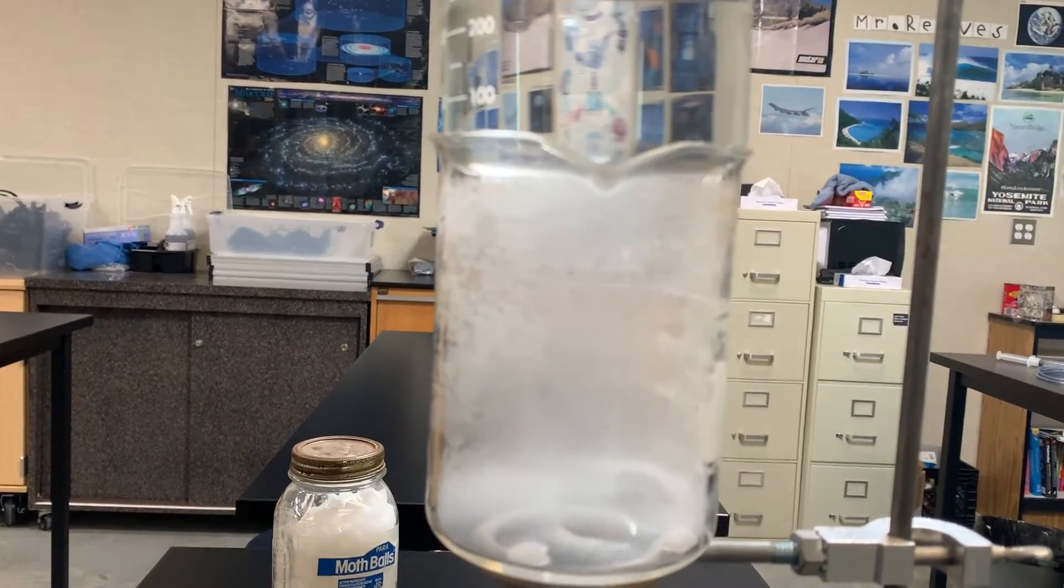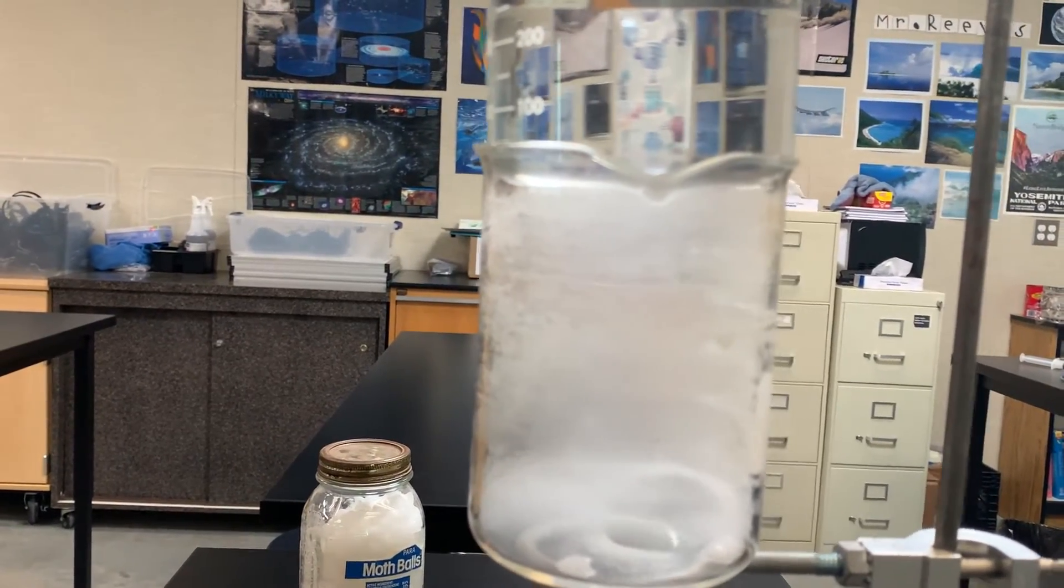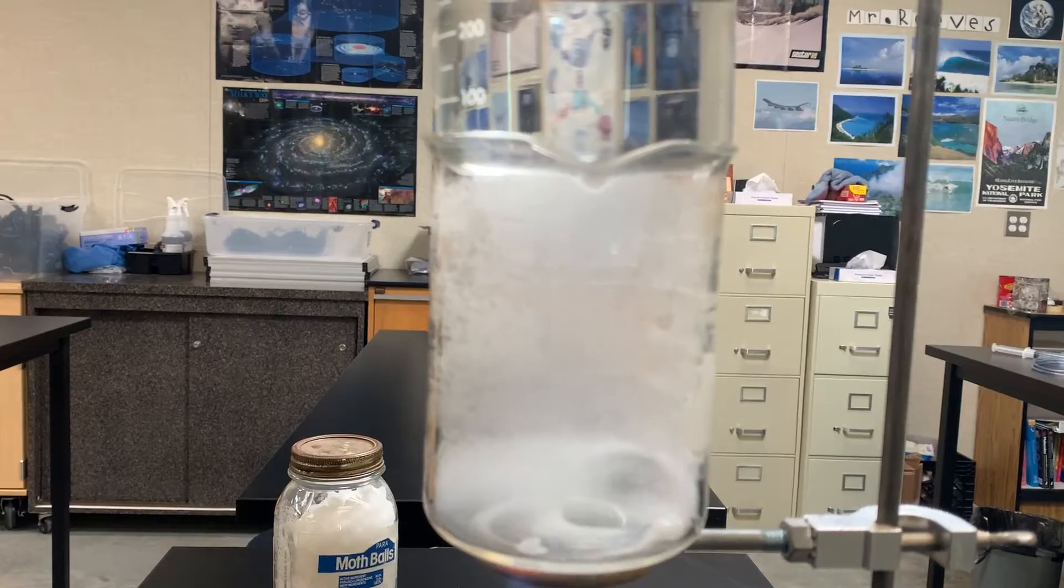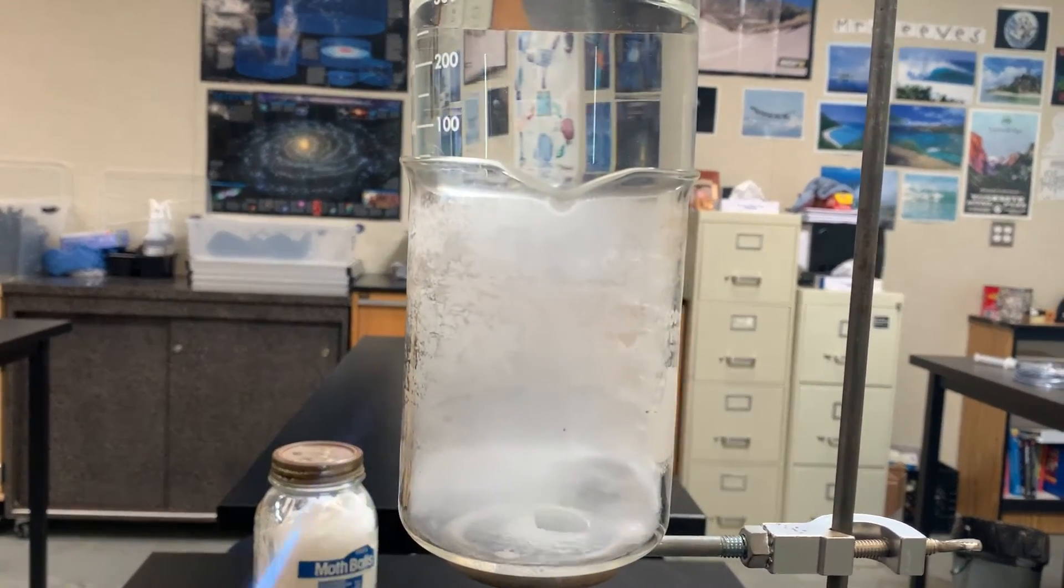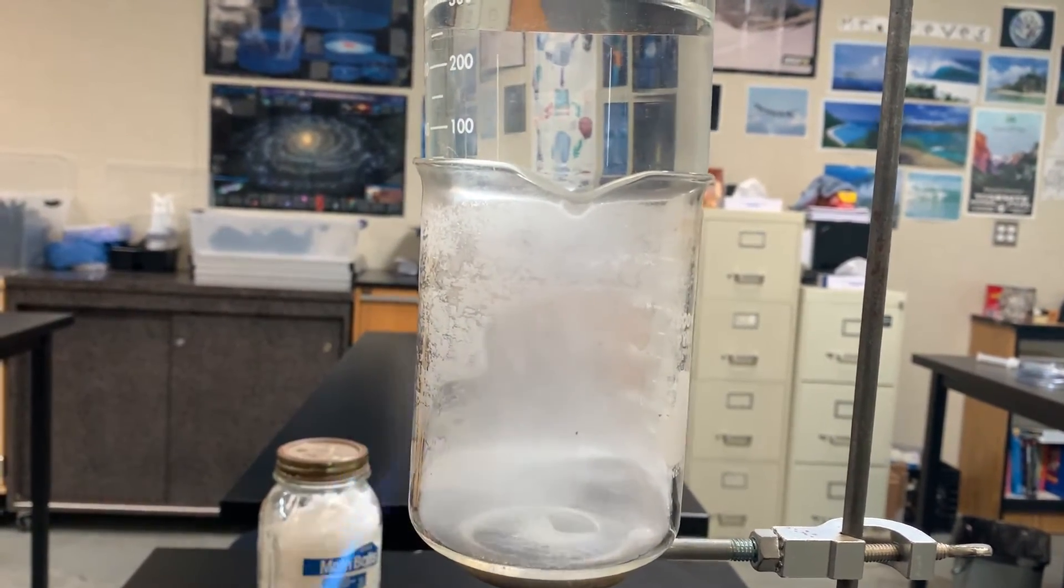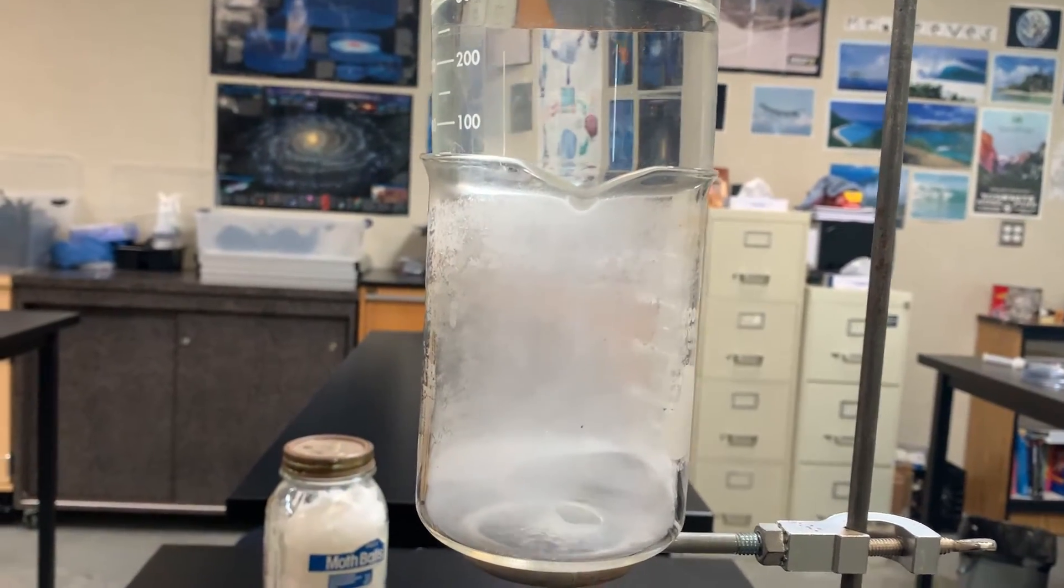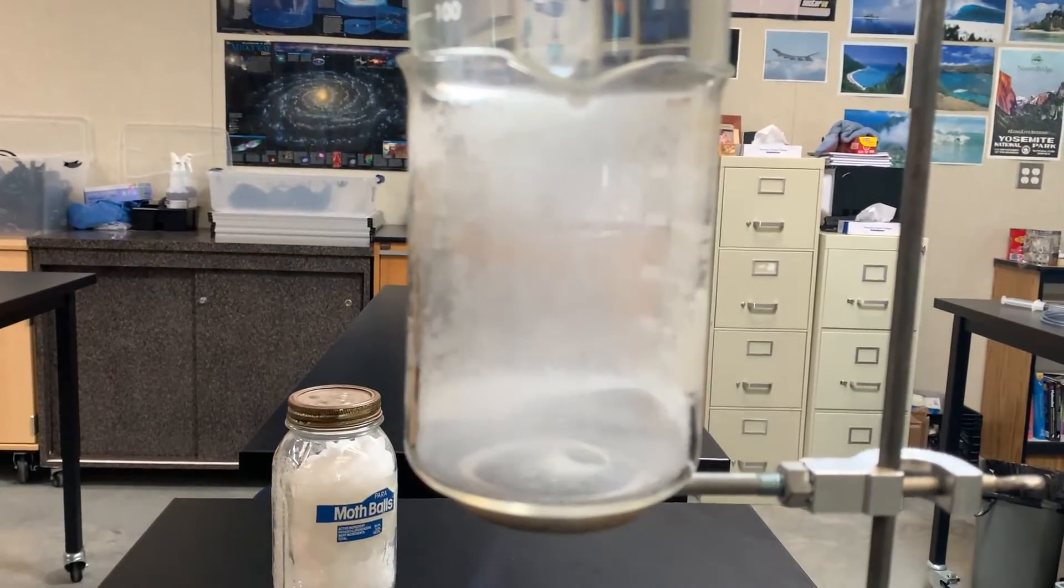Some of the gas is solidifying on the walls of the container. And I'm going to kind of get those. I want those particles off of there. So I'm going to get that up. It's boiling. The bottom is definitely boiling.